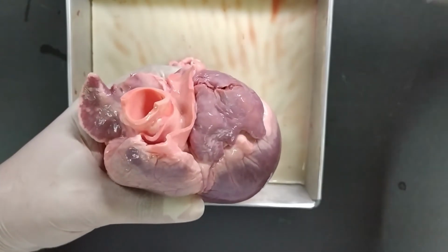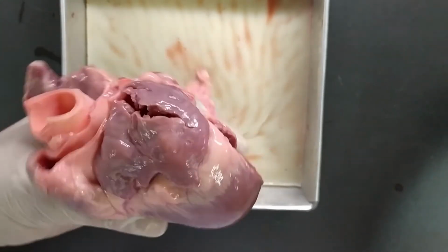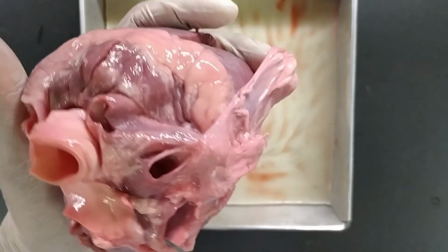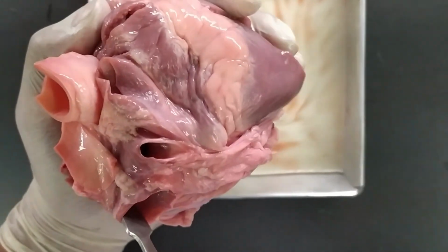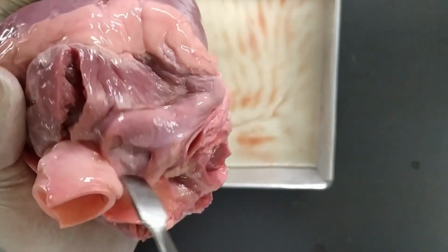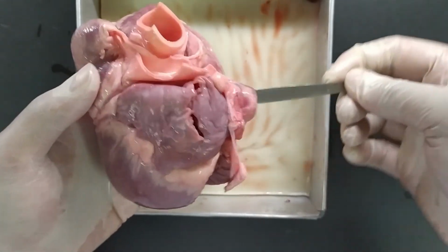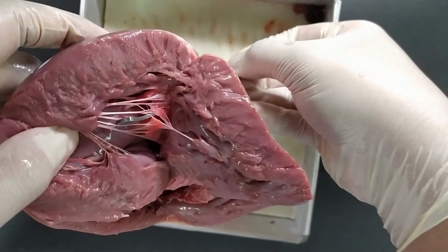In the lungs, deoxygenated blood will become oxygenated blood through the exchange of carbon dioxide and oxygen through the capillaries in the alveoli. This oxygenated blood will then move back into the heart through the pulmonary veins, entering the left atrium. These two blood vessels are your pulmonary veins, whereas in humans, we have 4 pulmonary veins radiating from the left side and the right side of the heart. In here, the blood will be delivered to the left atrium. Right after, it will pump blood down into the left ventricle, passing through the bicuspid valve.